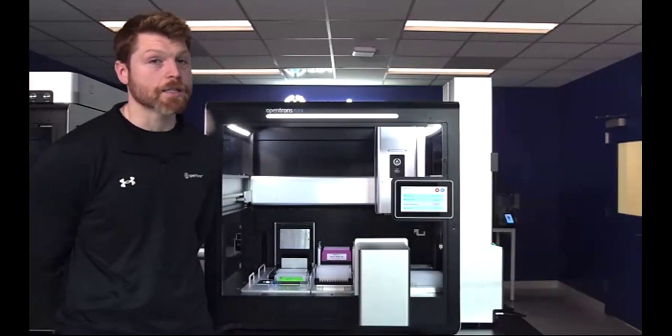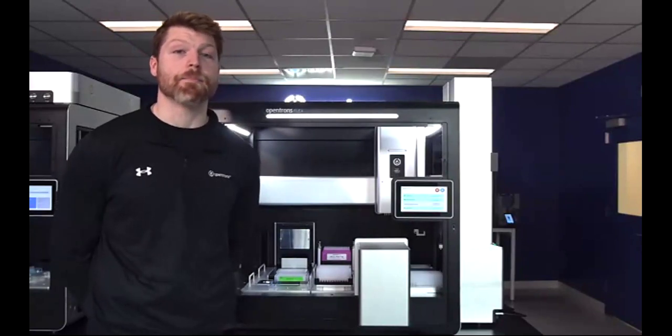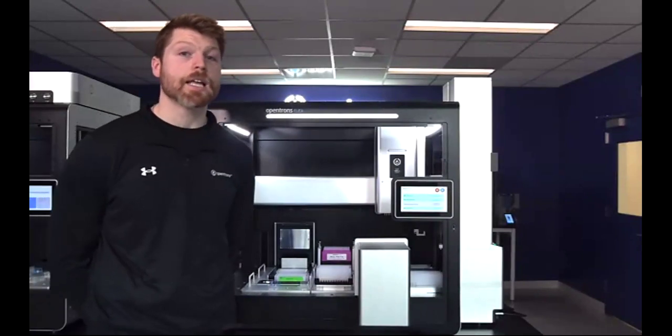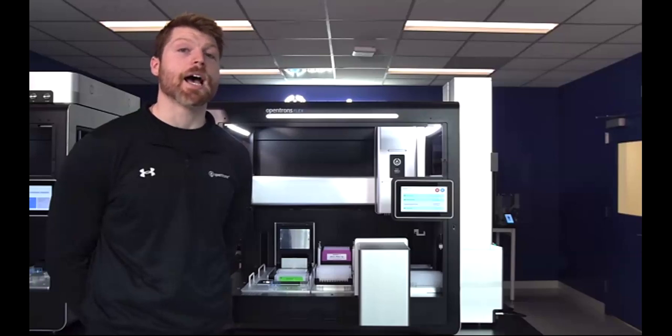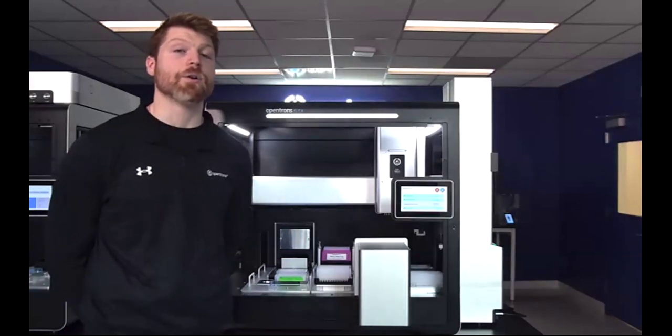The Flex is about a 3-foot cube and only takes up about 2/3 of a lab bench. This is about as space efficient as it gets for up to 96 sample throughput. Another key concept that we'll be talking about today is how you can increase that throughput with the stackers while minimally increasing that bench space footprint. And as we talk about the modules that sit indented into the Flex deck, you can see how, because those are all existing within that 3-foot cube, other solutions that need to have those outside or below or next to the robot take up so much more room.